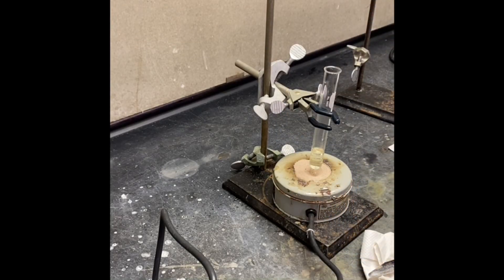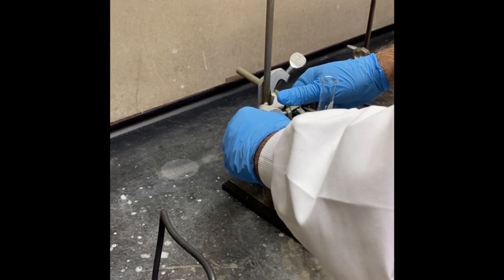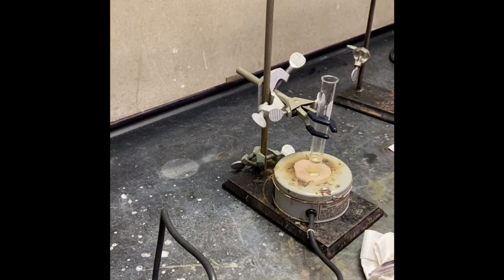Now we are going to heat that reaction mixture in a sand bath and we will put the thermometer in as well.